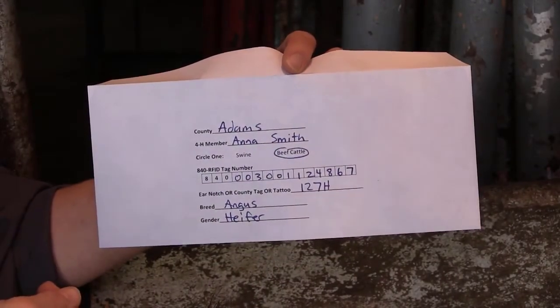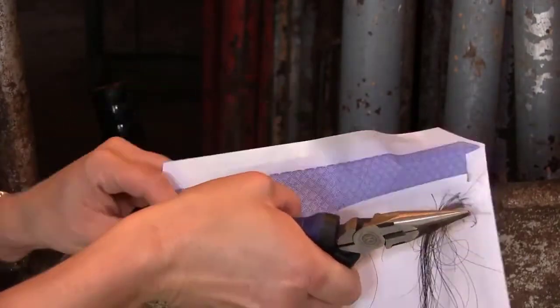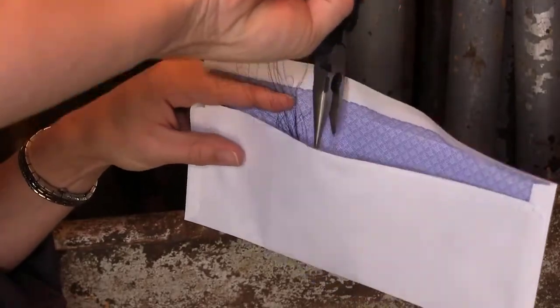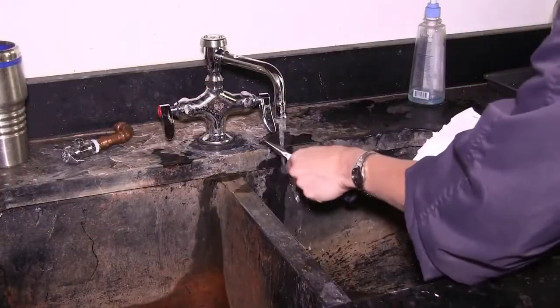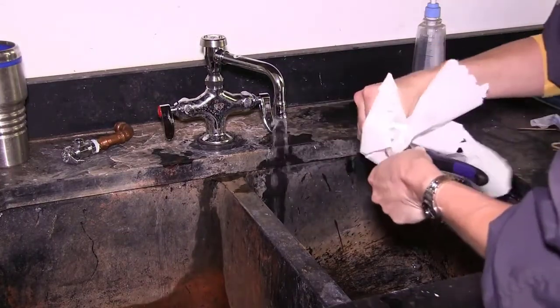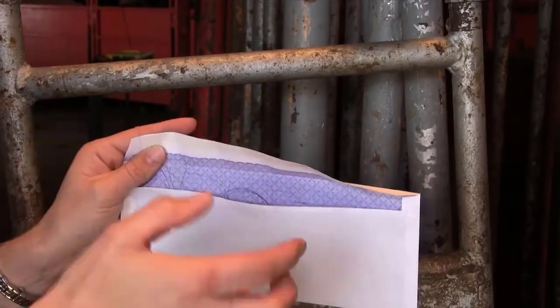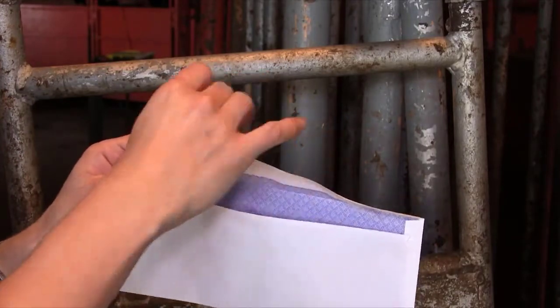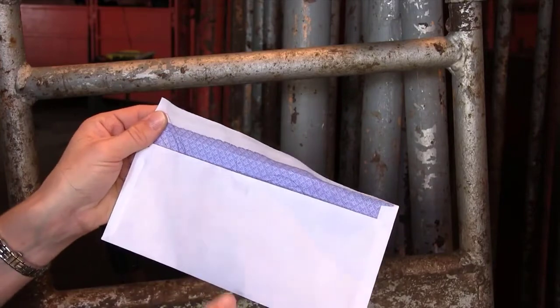Place your hair sample directly into the self-sealing collection envelope. Avoid touching the roots and using plastic bags. Then fill in the appropriate information on the envelope. Repeat this process for the remaining animals. Clean and dry the pliers and your hands between each collection to prevent contamination of the sample. The sealed collection envelopes with the information completed on the front should be turned in to your county Extension Office prior to the deadline for beef cattle ID in 4-H Online.